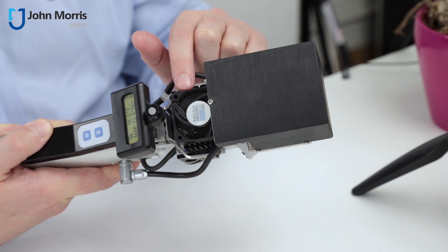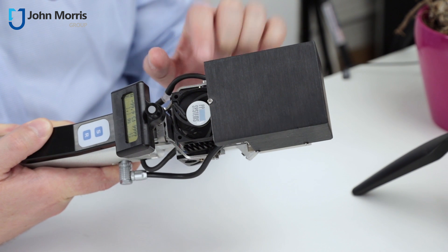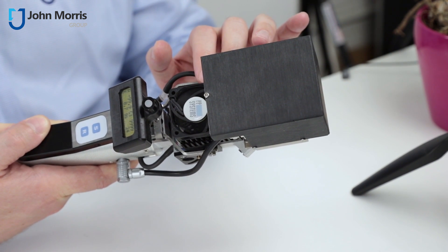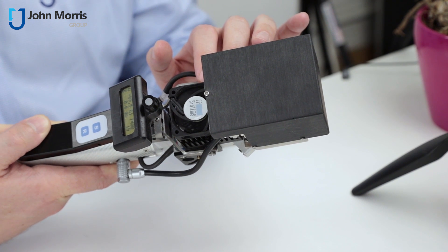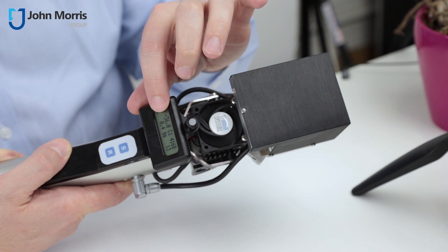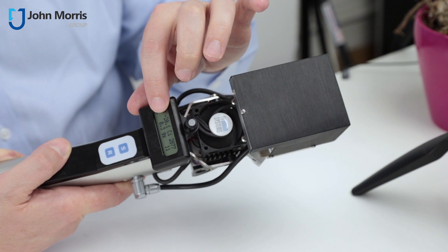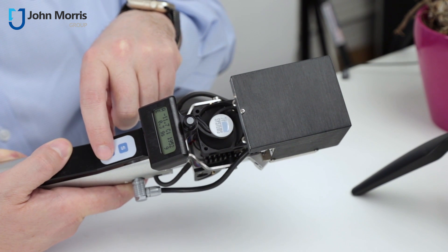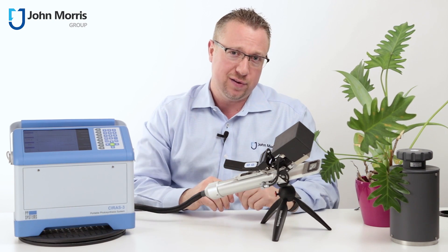You can also see the fan here pumping away to move air through this Peltier heater and cooler to make sure that it remains at its maximum efficiency. And here you have an ambient light sensor, and right here the display which tells you exactly what's happening inside the chamber. To take a reading, just click the R button, which is R for record. So let's close it over a leaf and see how we go.